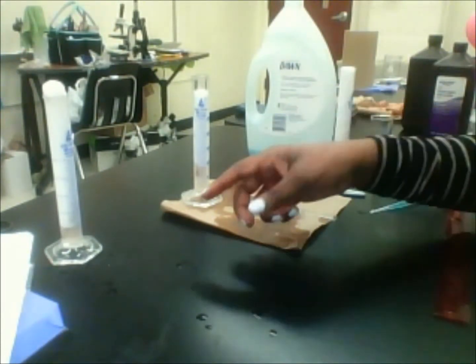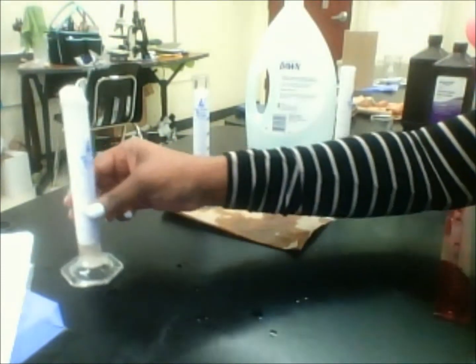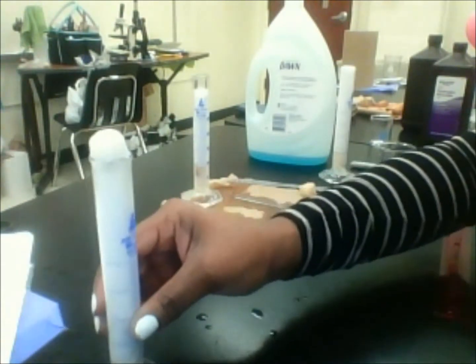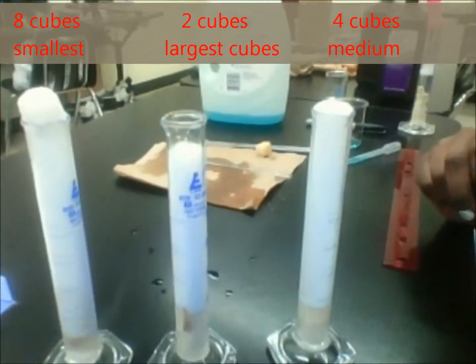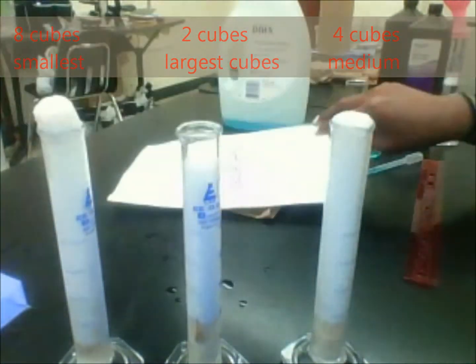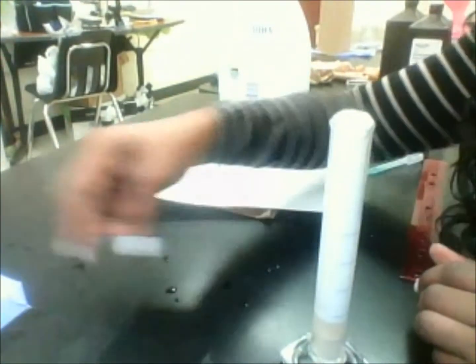So you can see this one, the one in eighths, was the largest. It produced the largest amount of bubbles. So this is what this one looks like. You can see again, and I'll show you all three side by side, that one had the most amount of bubbles. Okay, so let me put it here so y'all also see there.